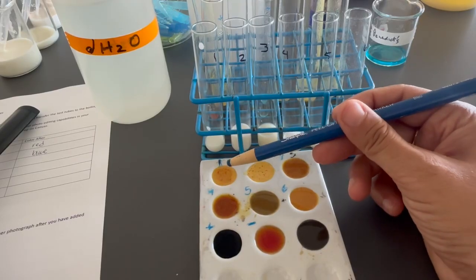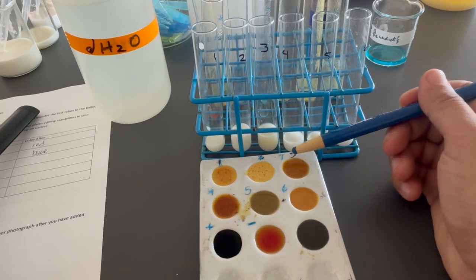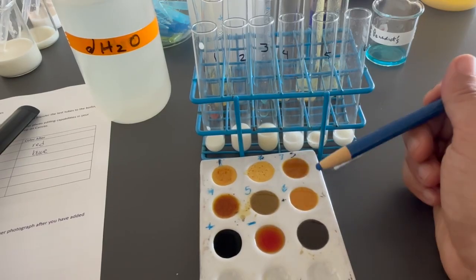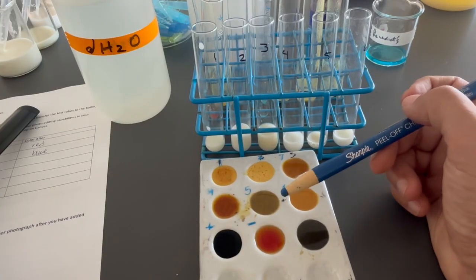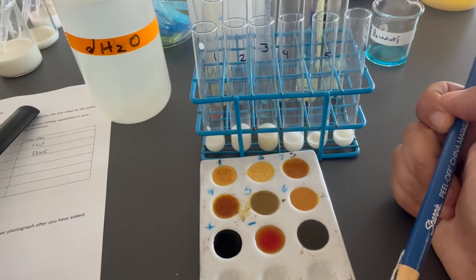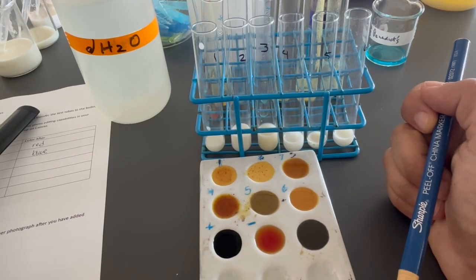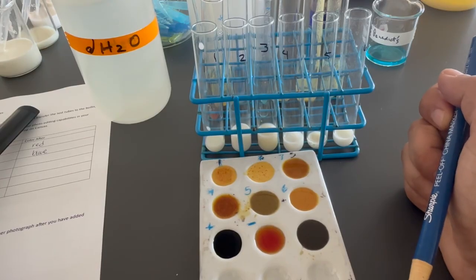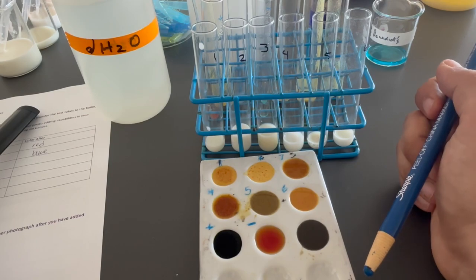So samples 1 through 4 showed negative results. This should be a positive result. This should be this right here. Sample number 5, a little bit of starch, and sample number 6, no starch, whereas our positive and negative controls showed the exact results that we would have expected. The negative control, the water, stays this amber color, and then the starch solution turns this deep blue-black, just as we've seen in this additional test that I did with the Kirkland oat milk, so unsweetened oat milk.